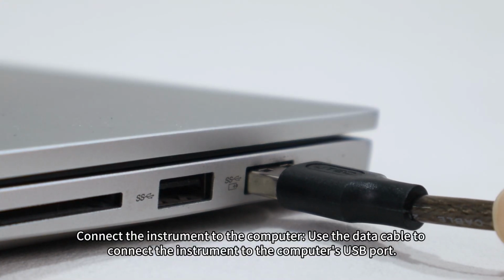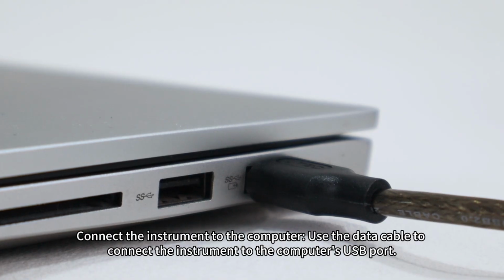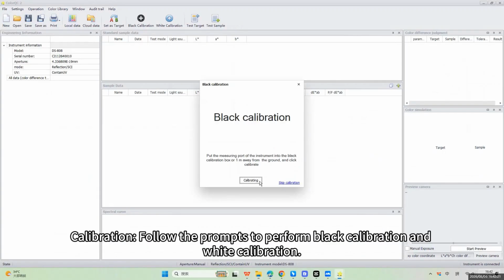Connect the instrument to the computer. Use the data cable to connect the instrument to the computer's USB port. If the connection is successful, the status bar at the lower right corner of the computer software will display connected. Calibration. Follow the prompts to perform black calibration and white calibration. Measure.